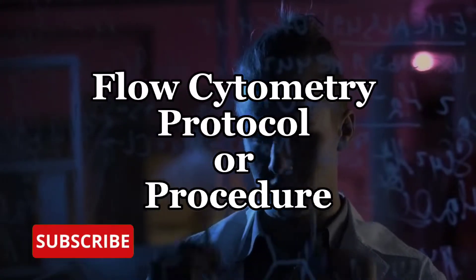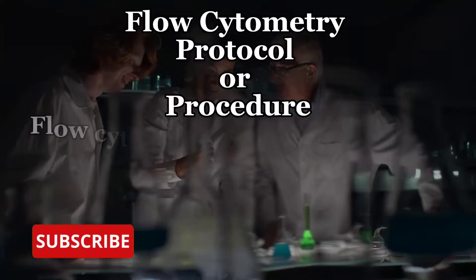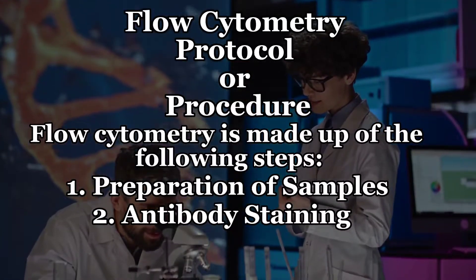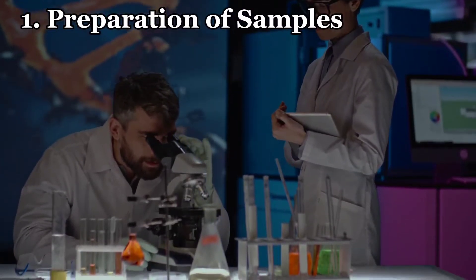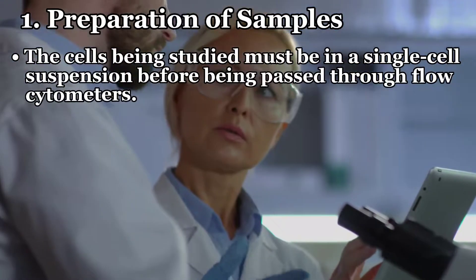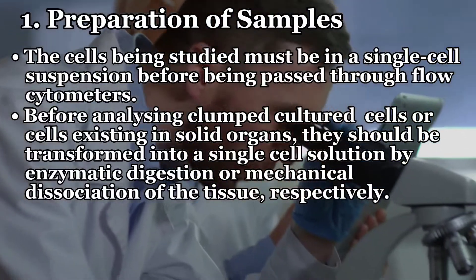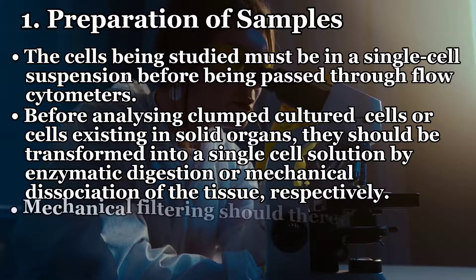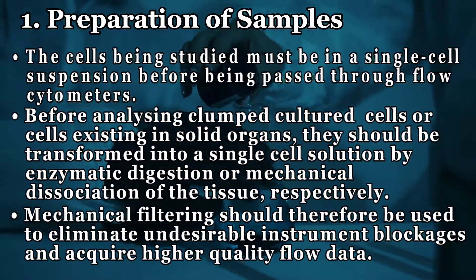Now let's head to the protocols or procedure of flow cytometry. Flow cytometry is made up of the following steps: number one, preparation of samples; number two, antibody staining; and number three, running samples. The cells being studied must be in a single-cell suspension before being passed through the flow cytometer. Before analyzing clumped cultured cells or cells existing in solid organs, they should be transformed into a single-cell solution by enzymatic digestion or mechanical dissociation of the tissue. Mechanical filtering should therefore be used to eliminate undesirable instrument blockage and acquire higher quality flow data.